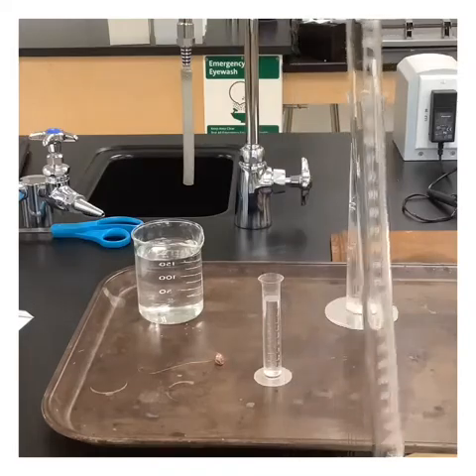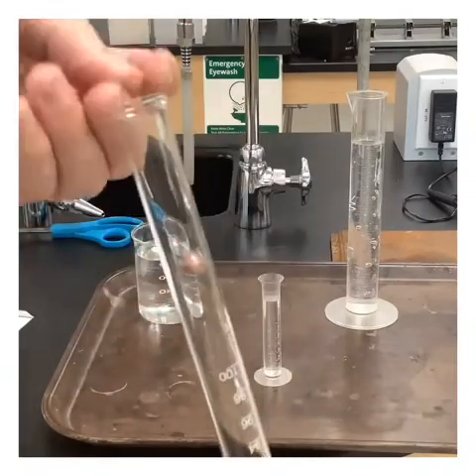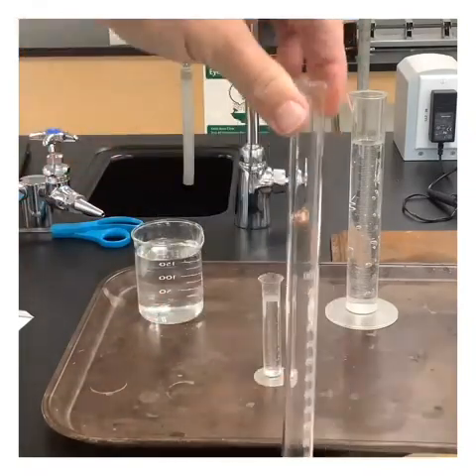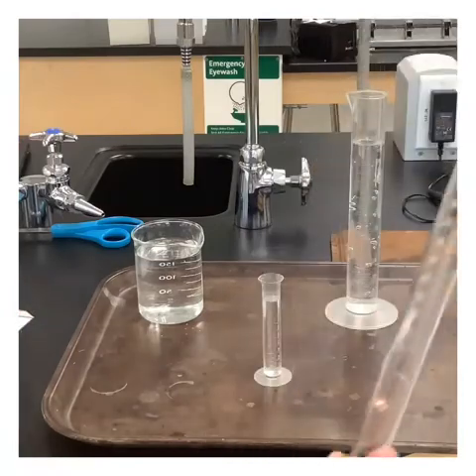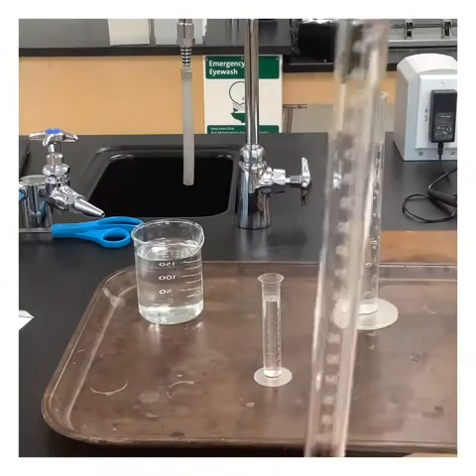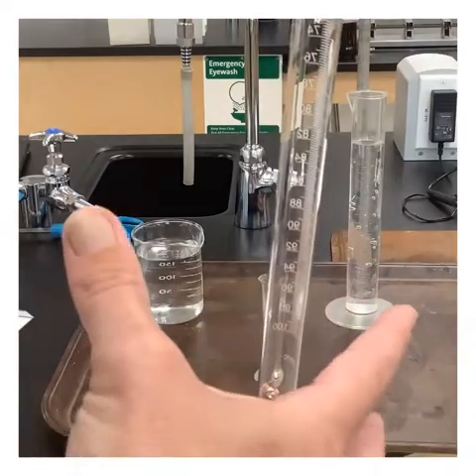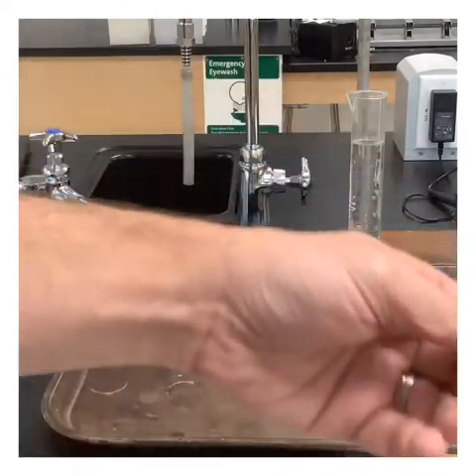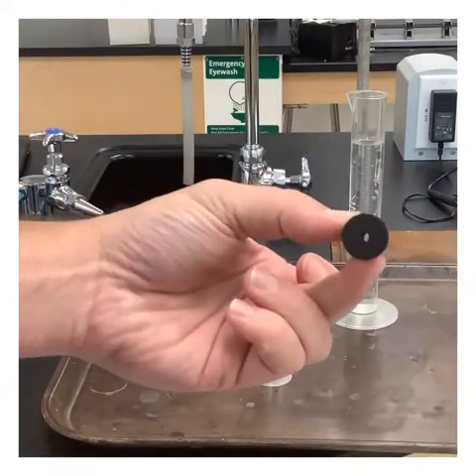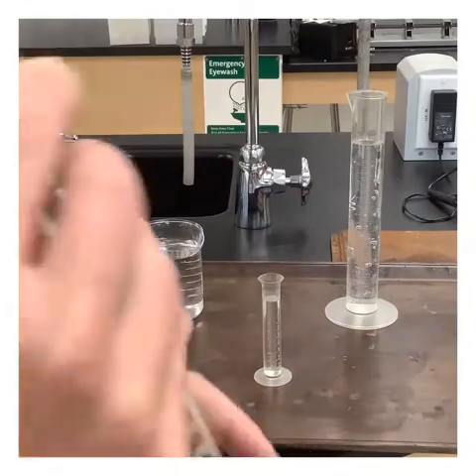Then I'm going to flip this over. So I'll be able to set my zinc, or I keep saying zinc, magnesium, into the tube here. It's just going to be sitting in water and it's not going to react. But then I flip it upside down, and what's the acid going to do? The acid is going to start sinking down through the tube until it hits the magnesium, and it starts reacting. Now when it reacts, where are the bubbles going to go? Straight up. In order to release the liquid, I'm going to be using a rubber stopper that's got a hole in it, so we can allow the water to escape through there, but the gas is going to remain trapped.